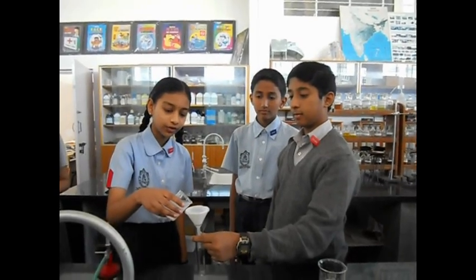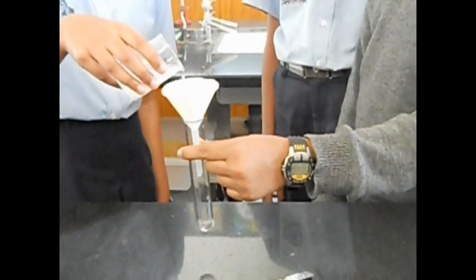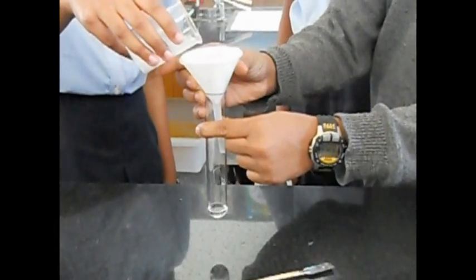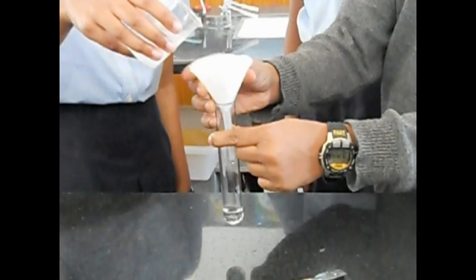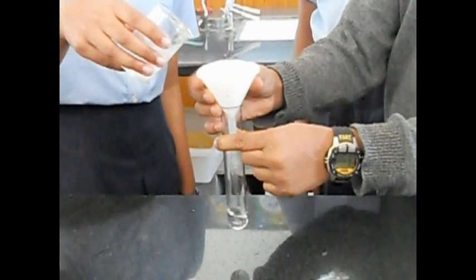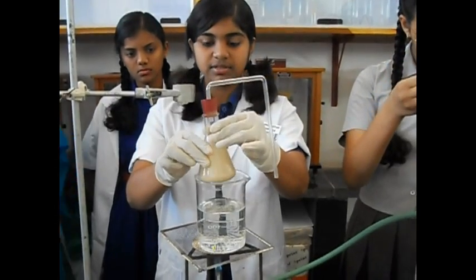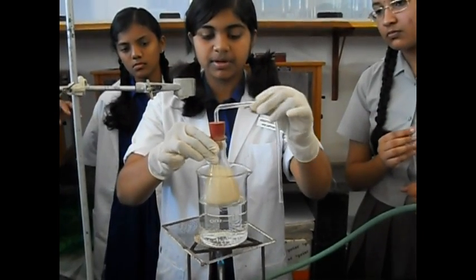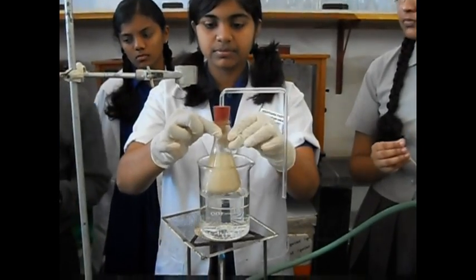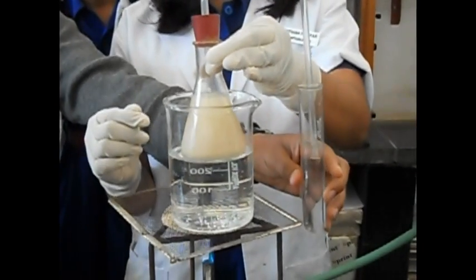We are filtering lime water. We have fixed a stopper to this conical flask. Let's heat this in a water bath for about two minutes at a temperature of about 35 to 40 degrees Celsius, and pass the carbon dioxide that is formed through the lime water.